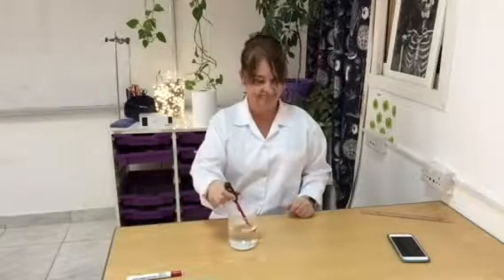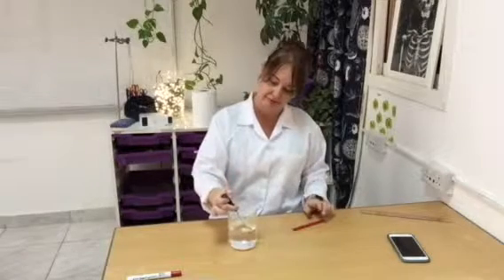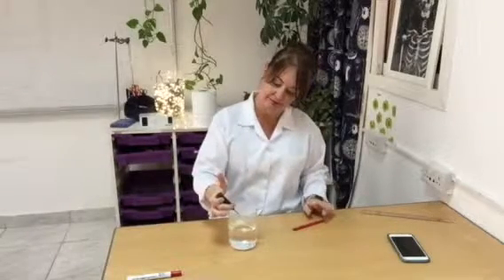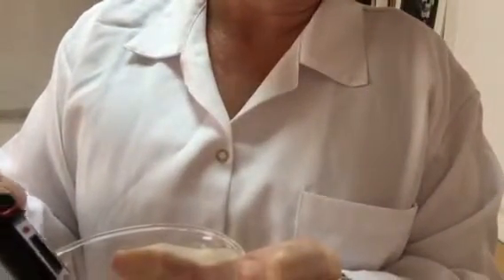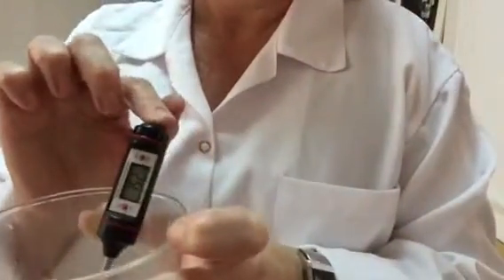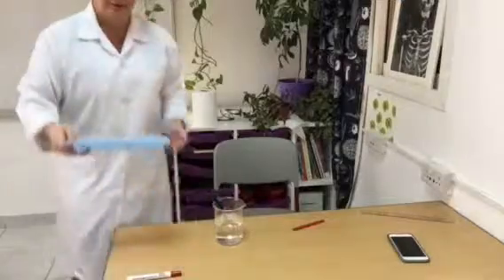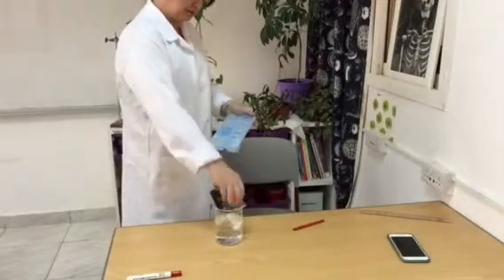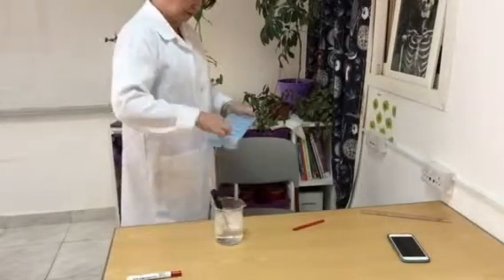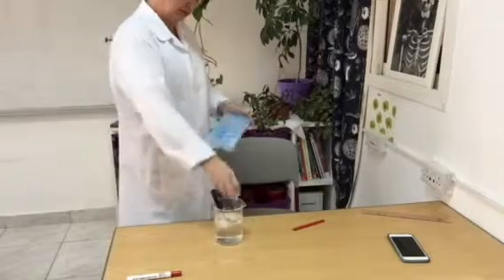Okay, moving on, we're going to be using a digital thermometer to measure a decrease in temperature of water. So, because I'm using a digital thermometer, it's a reading. I only have to consider one end. I don't need to consider the 0. So I take my reading there. Now the resolution of the instrument is 0.1 of a degree. So therefore the uncertainty is plus or minus 0.05 of a degree.